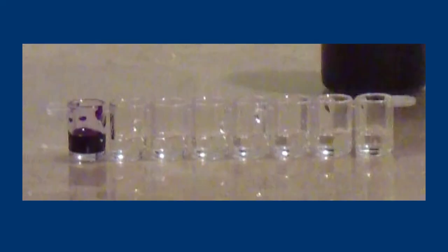In the next step you take 10 microliters from well number 1 and transfer it to well number 2. Pipette up and down to mix, then expel all the liquid by going down to the second stop.